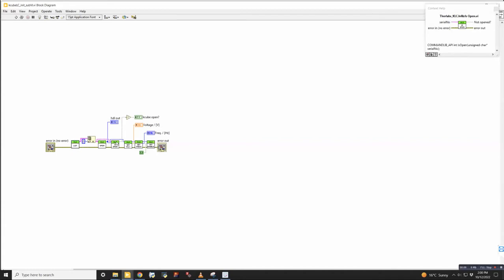Then once you've initialized it, you want to open the port. Then this one gets the current voltage. This one gets the frequency. So typically we run this at a constant frequency all the time. We just forget about it, but it's consistent and it's a number that we need to know. And then the last one is enable. So basically we make the connection to it, figure out what all the settings are, and then we enable it so that it's working with those settings.